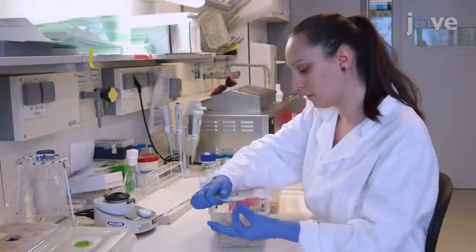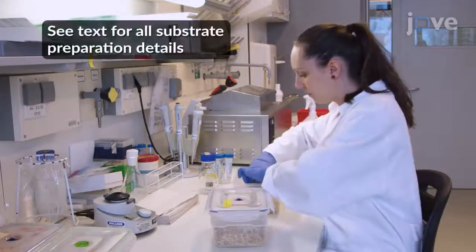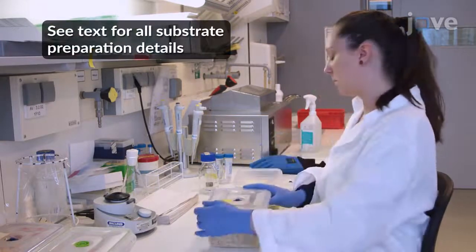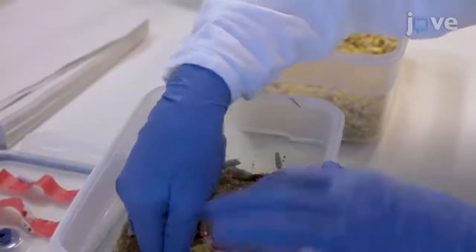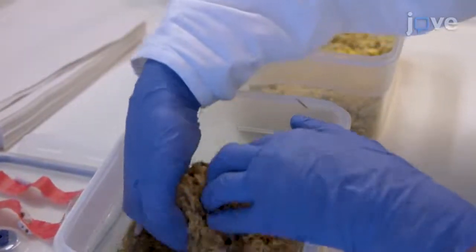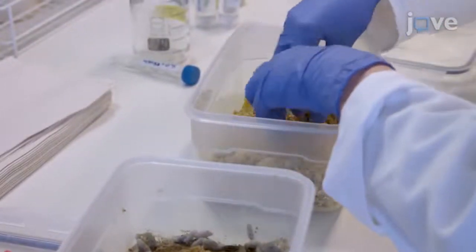Begin by transferring the eggs laid by adult moths to 2-liter boxes containing wax moth substrate at 30 degrees Celsius in the dark. After 1 to 2 weeks, transfer 25 grams of larva-containing substrate into fresh substrate when small and tiny larvae become visible.